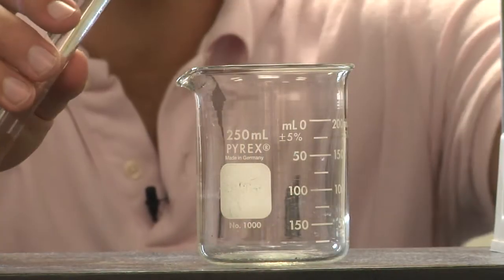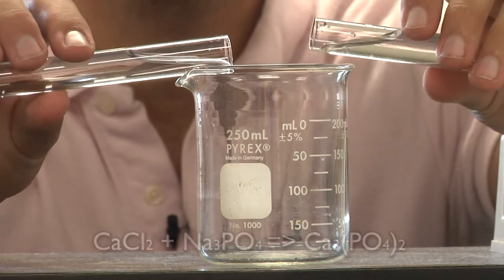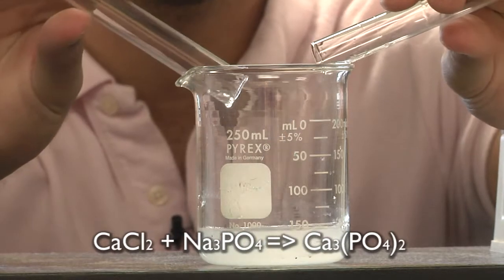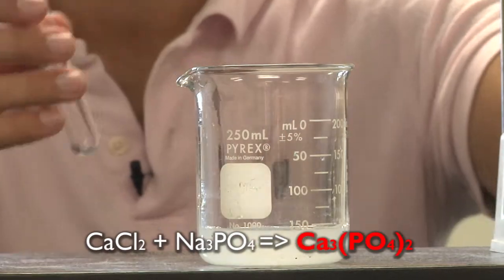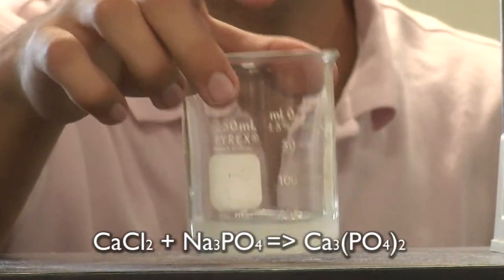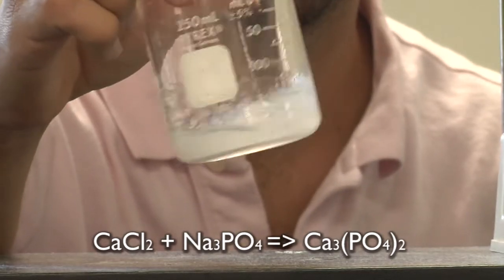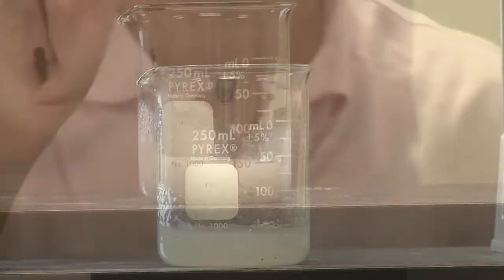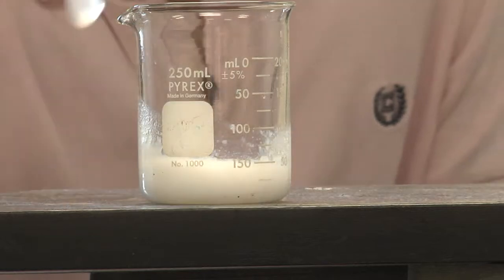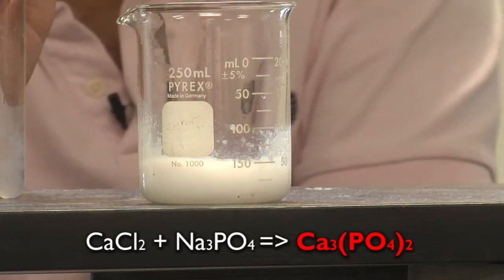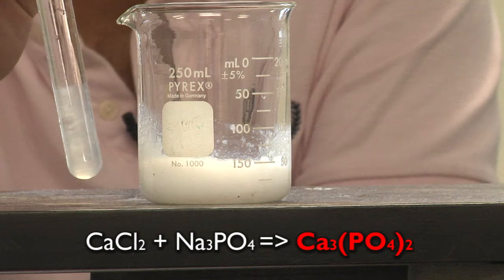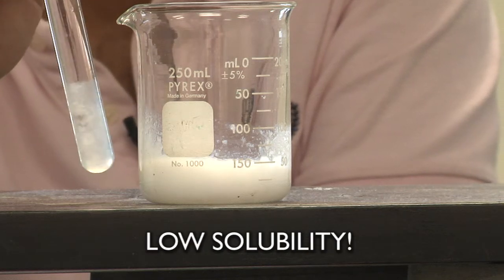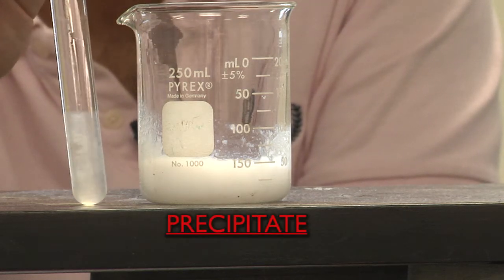This lab is literally just mixing two samples and watching them form a salt. From this reaction, tricalcium phosphate will be produced. Tricalcium phosphate has an extremely low solubility. Therefore, most of it will precipitate out in your reaction.